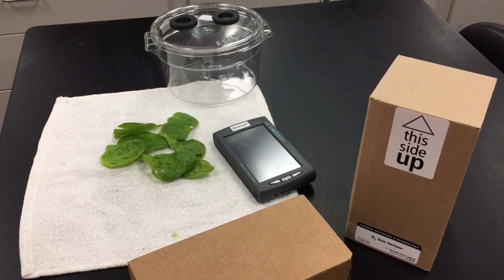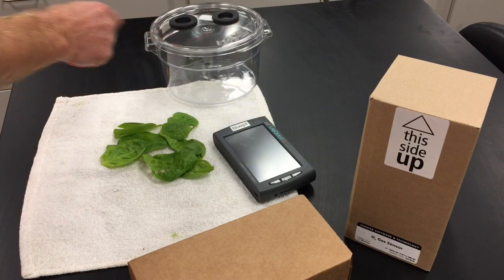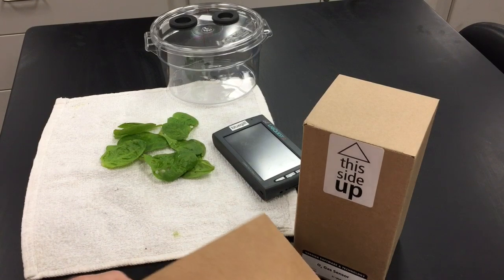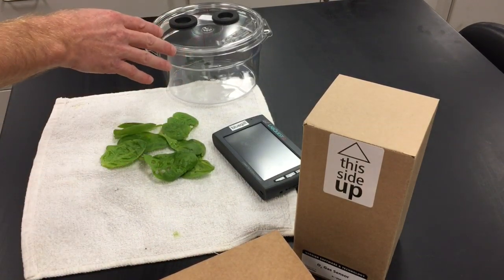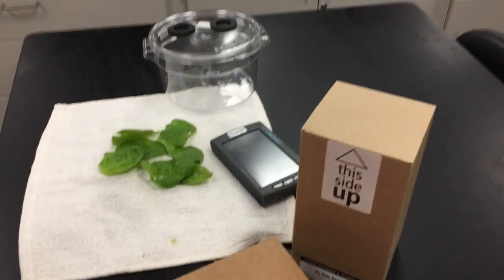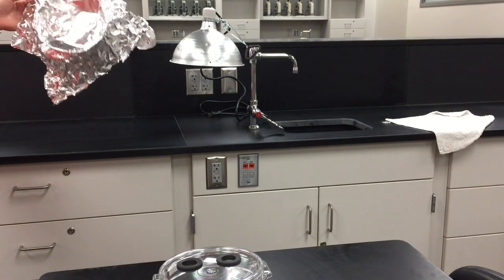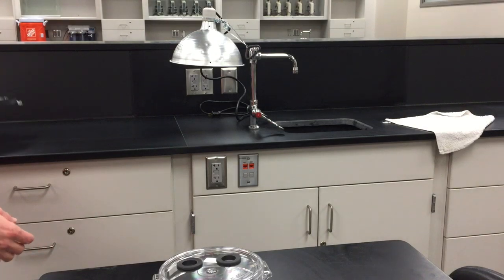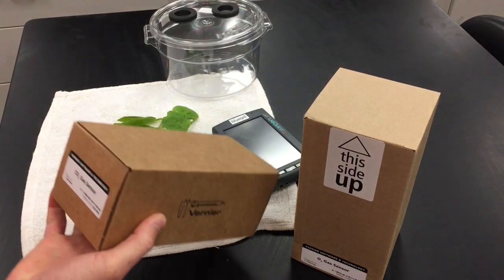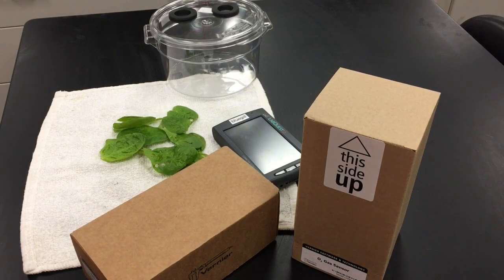We're going to go over how to run the photosynthesis and cellular respiration activity. We'll use spinach leaves, placing them in a chamber with the Vernier LabQuest, a carbon dioxide gas sensor, and an oxygen gas sensor. We'll put the spinach leaves under light or in a dark situation — in the light, photosynthesis should be occurring, and we'll use aluminum foil to cover up the experiment for the dark environment. We'll use these sensors to measure the amount of carbon dioxide or oxygen gas being used or released by the plant in both environments.